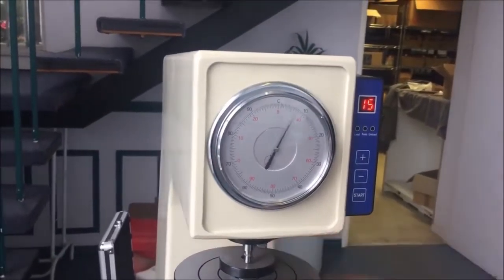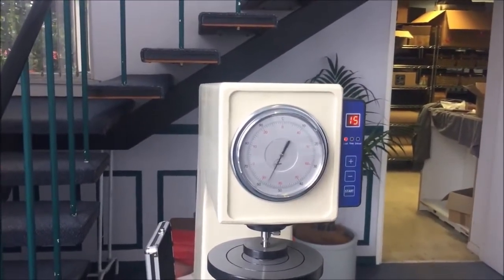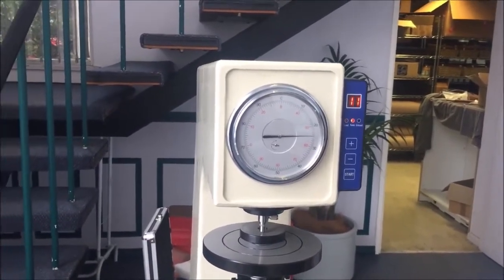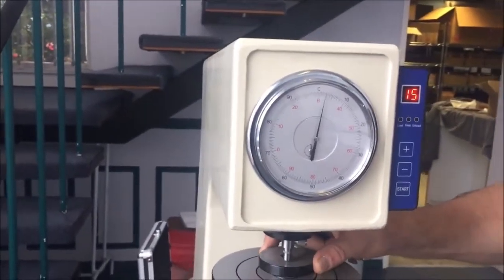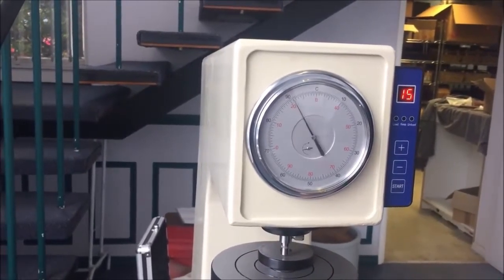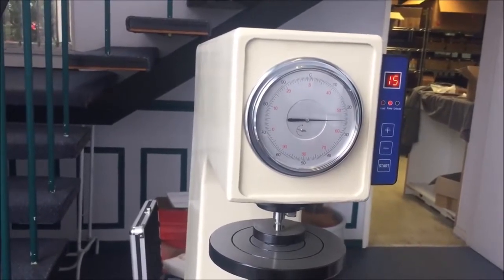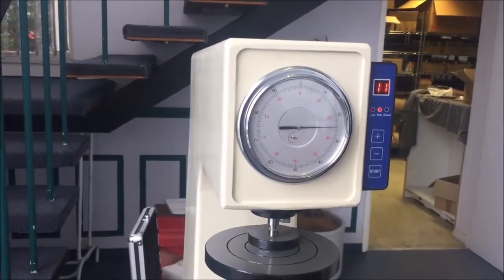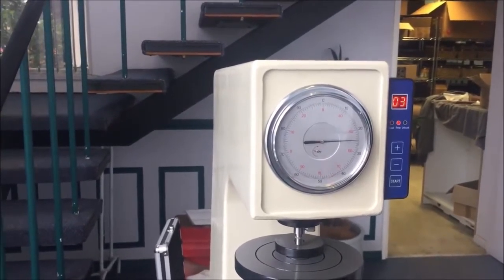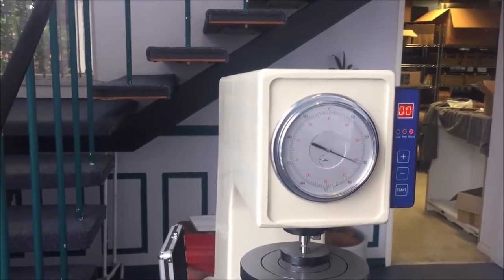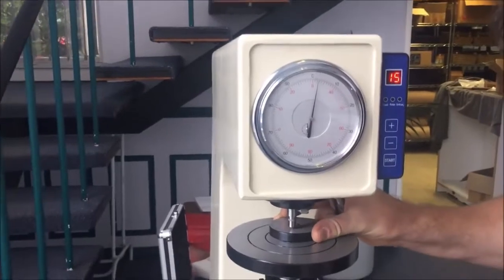That's not an instruction by the way. If you go to the pub and get injured in the process, we don't take any liability. That's just a figure of speech. We're just going to do three readings to make sure that they average around that same figure. 61. Bear in mind there is always going to be some variation, so don't get too stressed about half measures. Can be differences in grease or a particle of dust on the plate, anything can affect it. A half a Rockwell accuracy, so always take three or four readings. I think Kevin Cashen said to me once he discards his first three or four readings, and then he takes five to ten readings along the ricasso and then does an average.